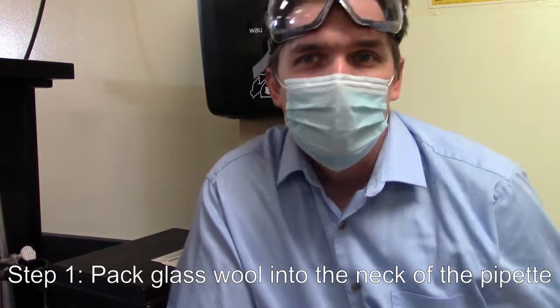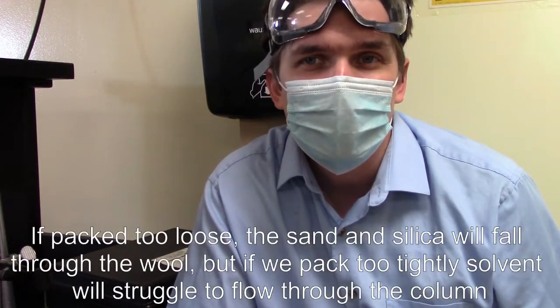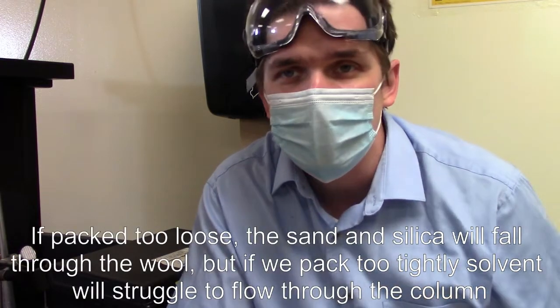Now there's kind of an art with this and I say that because if we pack it too loosely, a lot of our packing material is going to fall through the column. And so we don't want to pack it so loosely that all the sand and all the silica gel comes out.